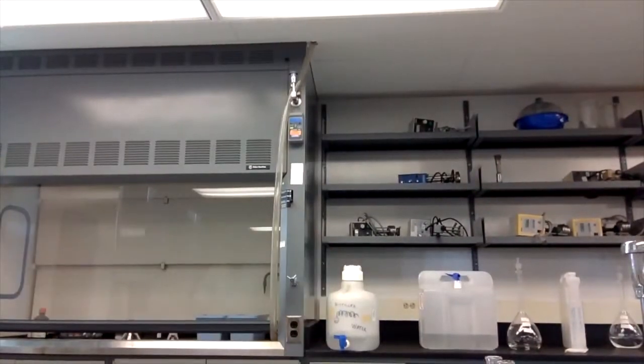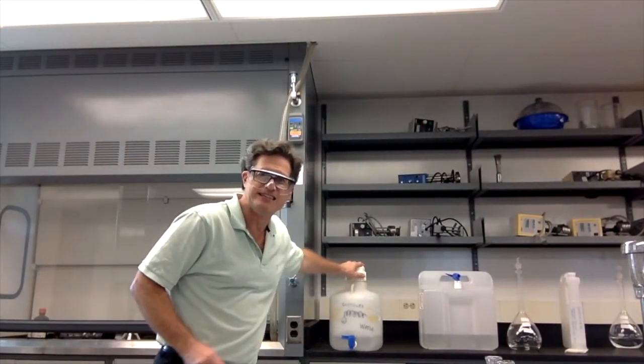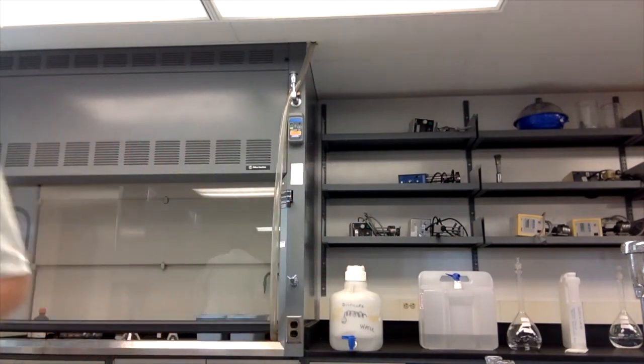glassware was clean in the first place, because you have to be meticulous about using high purity, right? You want no other ions. So what are we going to make our solutions out of? Ooh, we're going to use not just DI water, but we're deionized and then distilled. We use the good water because we have to have the lowest possible background of other ions.